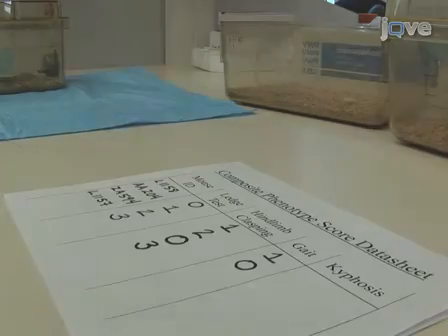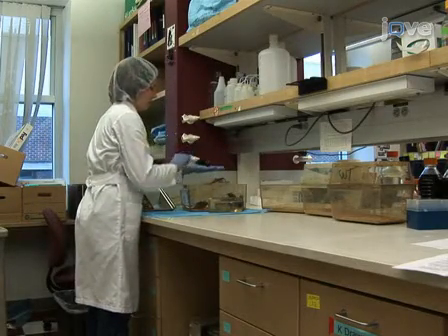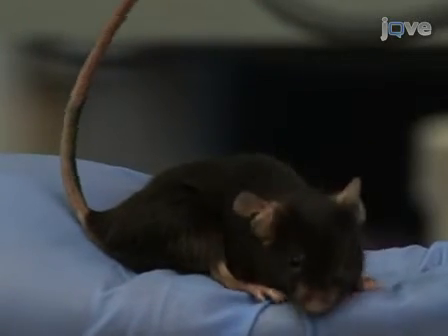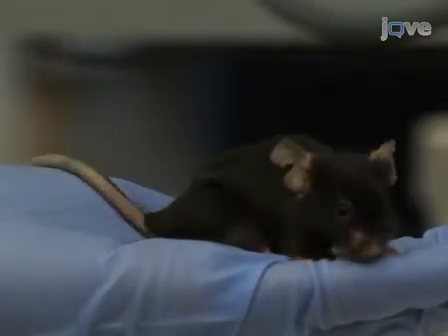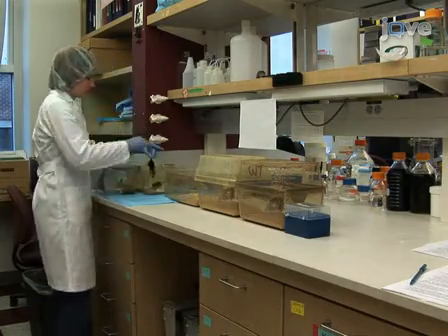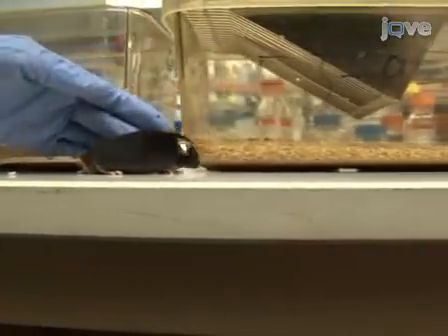Now let's see the kyphosis test. Kyphosis is a characteristic dorsal curvature of the spine that is a common manifestation of neurodegenerative disease involving motor systems, including spinocerebellar ataxias, in mouse models. It is caused by a loss of muscle tone in the spinal muscles secondary to neurodegeneration. To begin, remove the mouse from its cage and place it on a flat surface. Observe it as it walks. If the mouse is able to easily straighten its spine as it walks and does not have persistent kyphosis, it receives a score of 0.